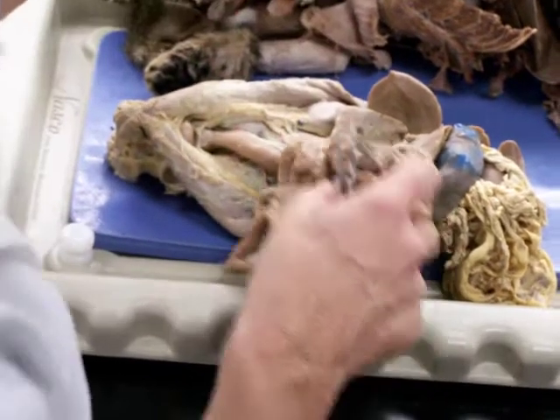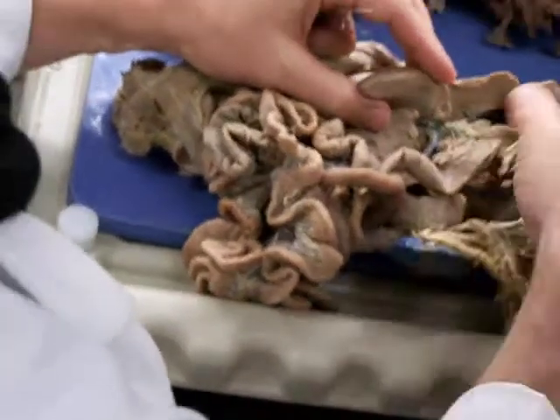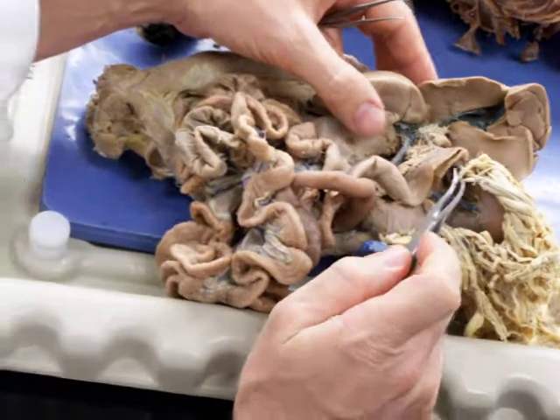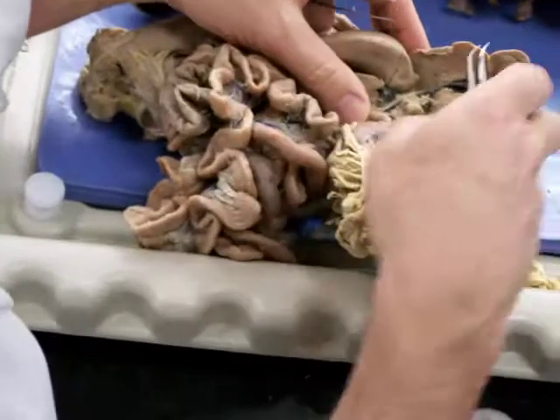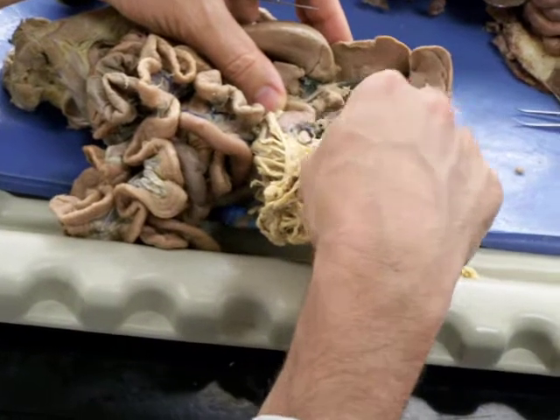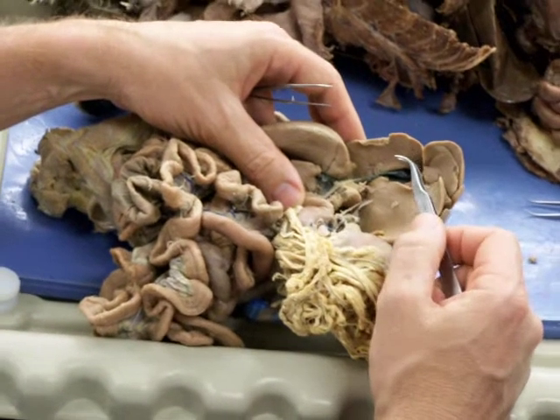And so the large blue vein that we find here is the hepatic portal vein, which runs into the lesser omentum and up to the liver. Okay, the lesser omentum is the connective tissue that was originally around this that kind of connects the liver with this pyloric region and lesser curvature of the stomach. And the lesser omentum continues down along the lesser curvature of the stomach.